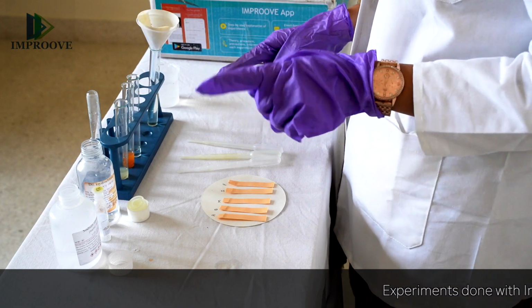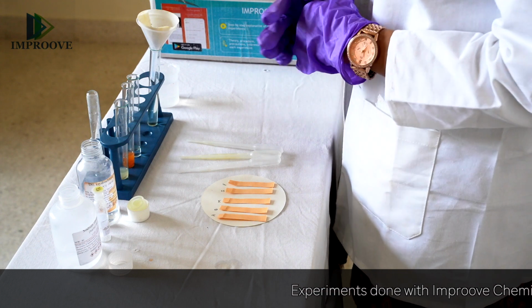So pH stands for potential of hydrogen ions, and it tests the concentration of hydrogen ions in any solution, which determines whether the solution is acidic or basic in nature. Generally at 25 degrees Celsius or 298 Kelvin, a neutral solution, which is neither acidic nor basic, shows a pH reading of 7. Anything less than 7 means that it is acidic, and anything more than 7 shows that it is alkaline. To begin the experiment, you must also have pH strips and droppers ready.